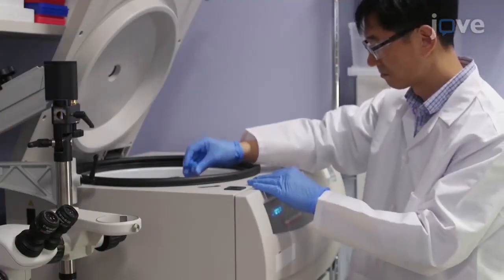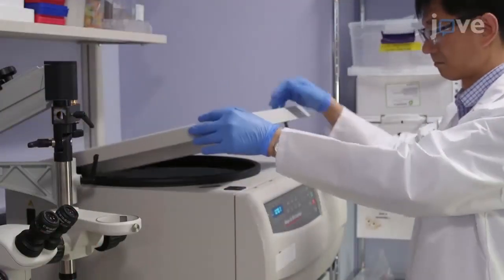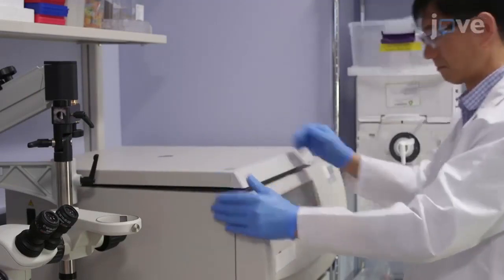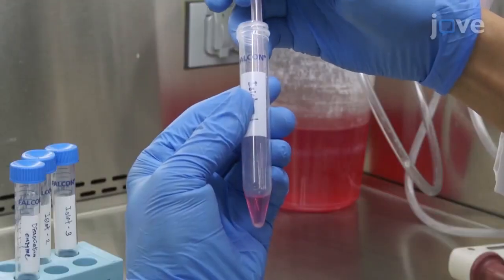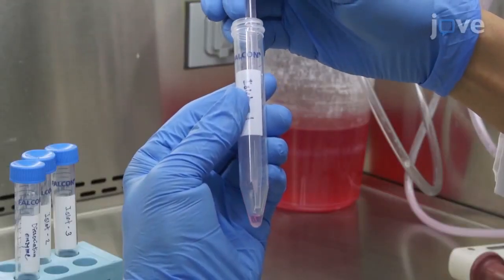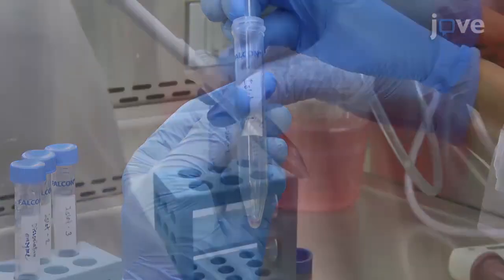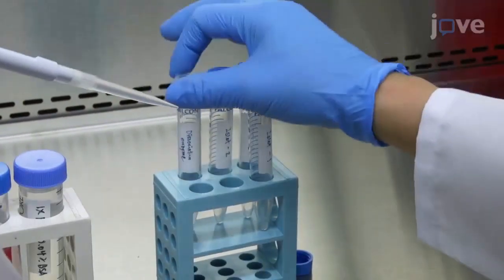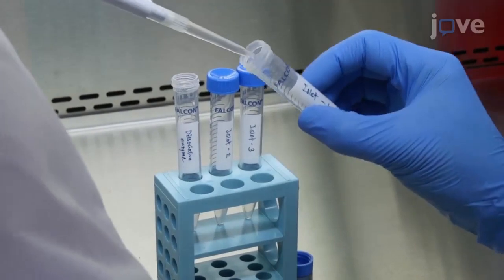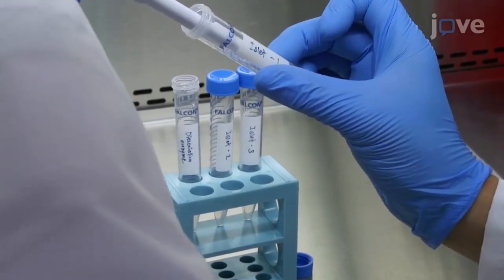Place the tube in a centrifuge at 200 times G for 2 minutes. Gently aspirate the supernatant without disturbing the pellet on the bottom. Add 1 mL of pre-warmed cell dissociation solution and disrupt the pellet by pipetting gently up and down.